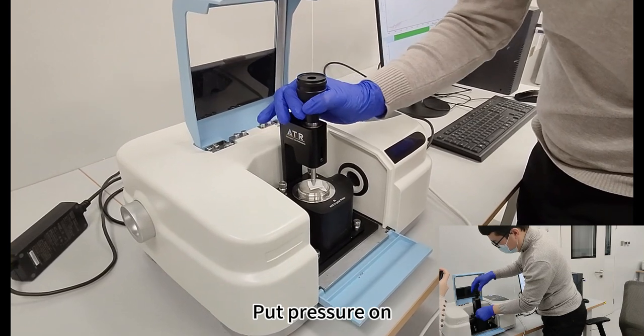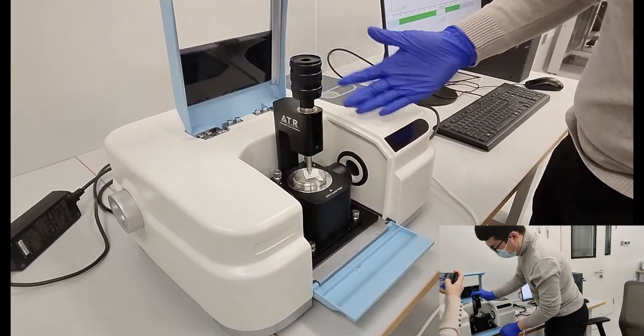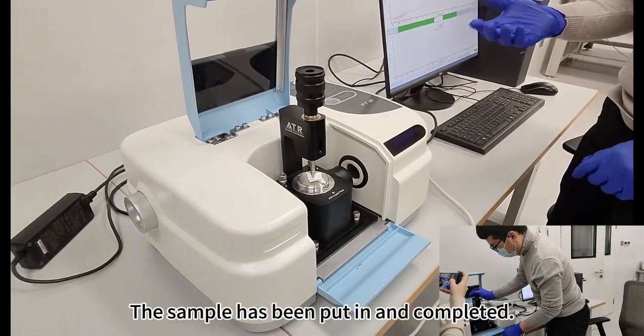Put pressure on. The sample has been put in and completed.